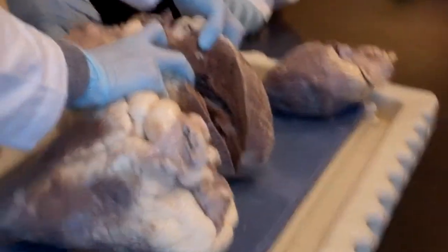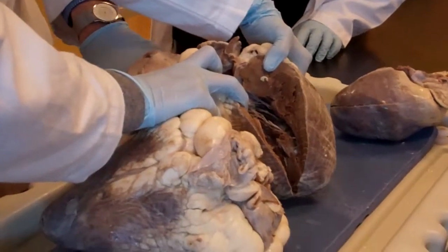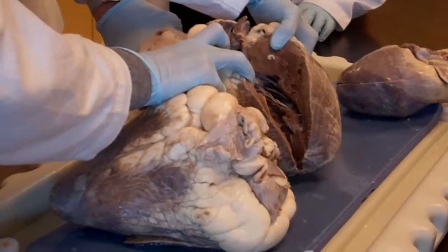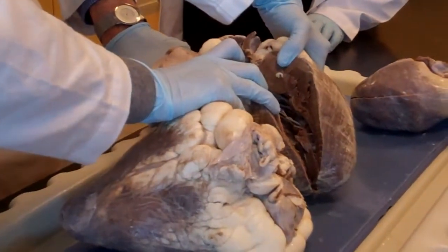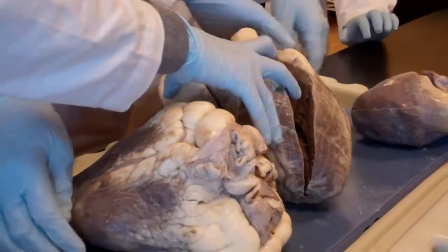Now if I put my finger, try to push it forward. Here's my finger, it's not going anywhere because it's held by one of the pockets of the valve. See, it's not going anywhere. You see it, but it doesn't go through. That's the longest one I have. I can't go any further.